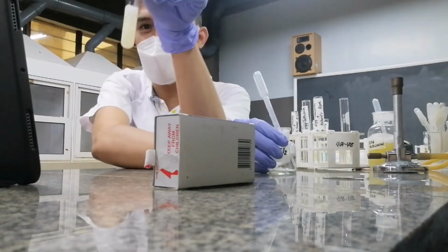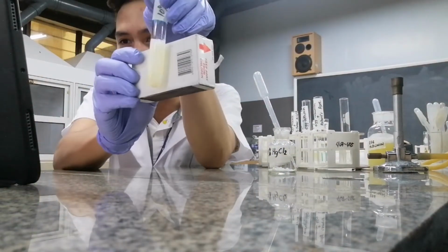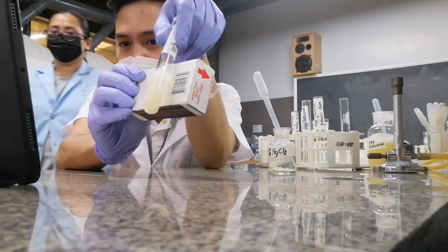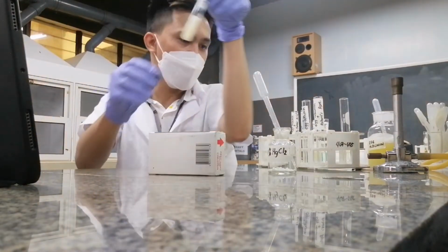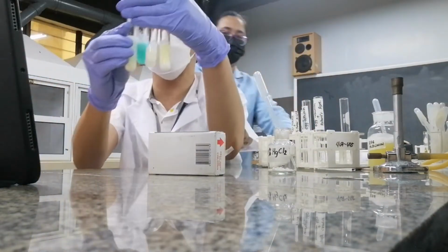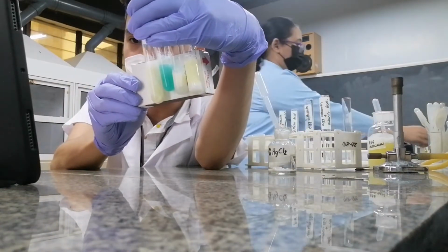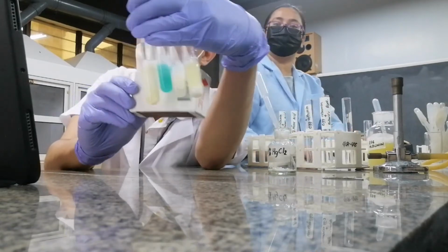Okay, so what did you notice as well? Diba? There is also a precipitate that is actually forming, correct? So this is also precipitation. What's the color? The color is white. Okay? So these are now the results of your heavy metals. As you could see, heavy metals precipitate your proteins. They precipitate your protein. So only copper has a differently colored precipitate.